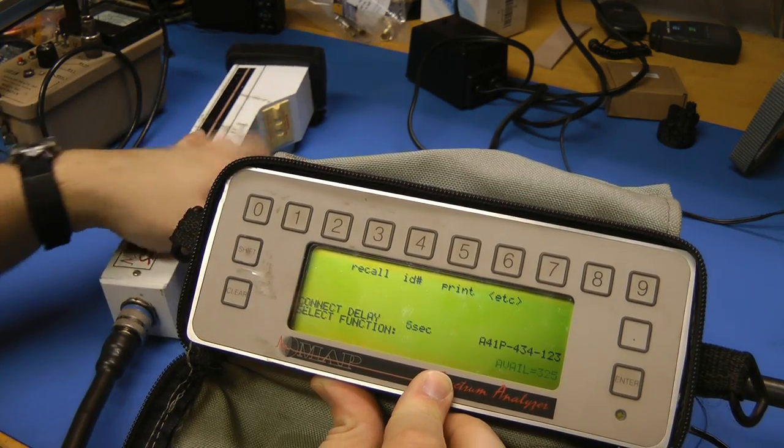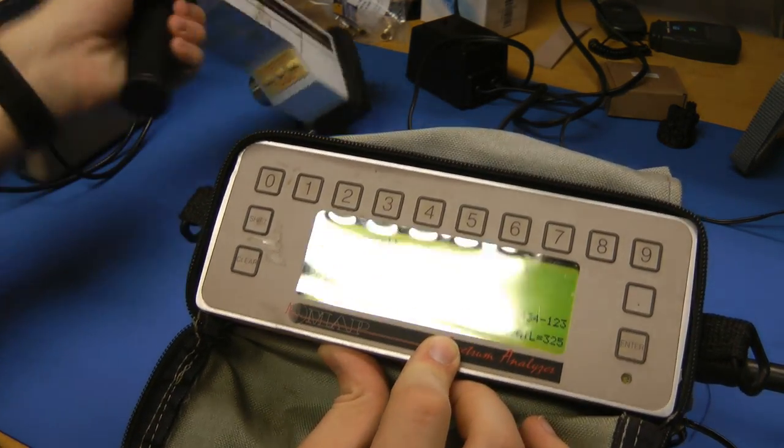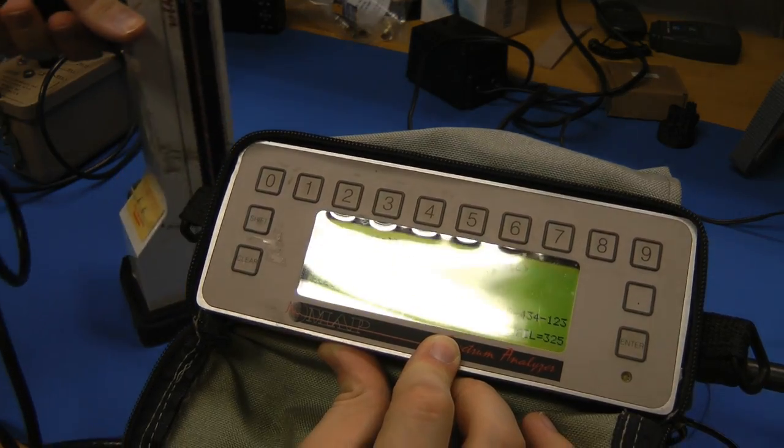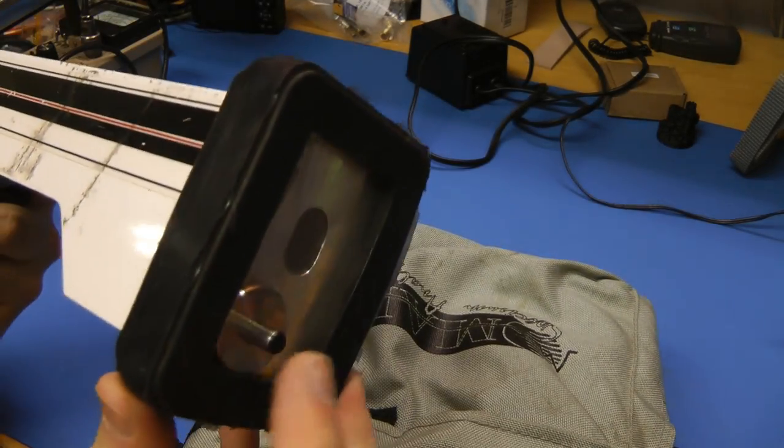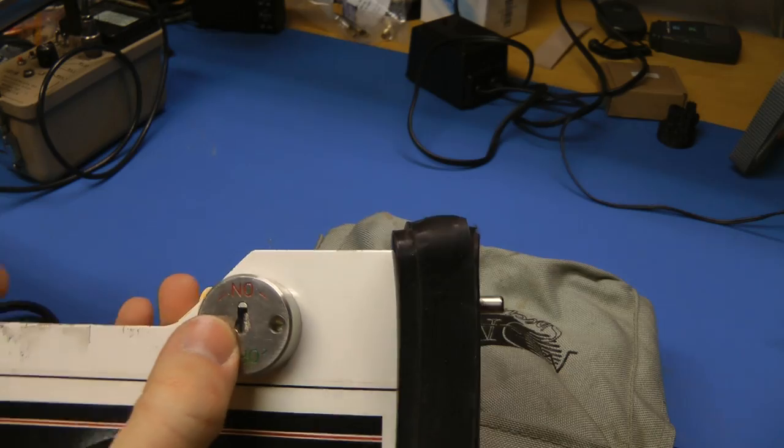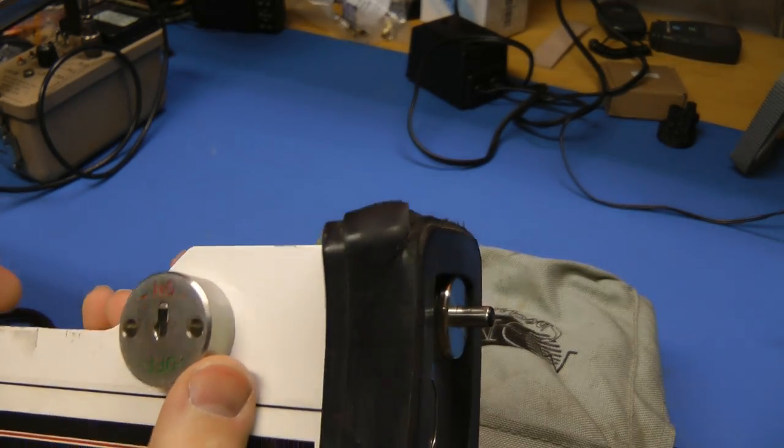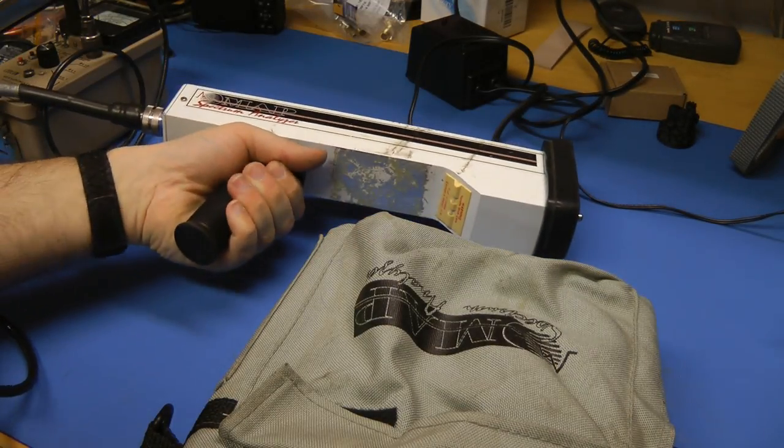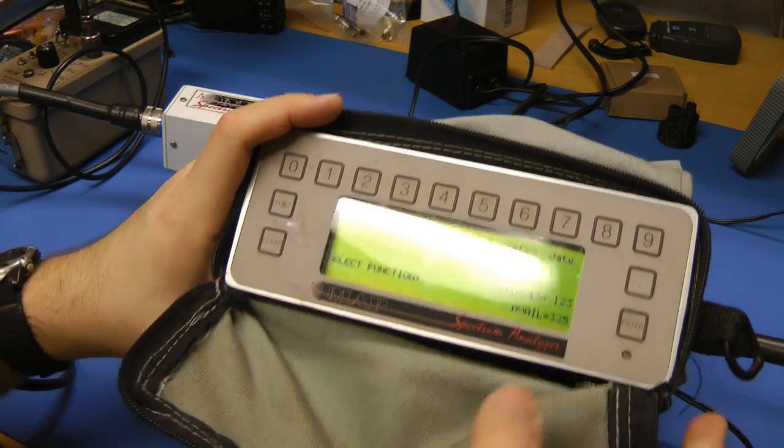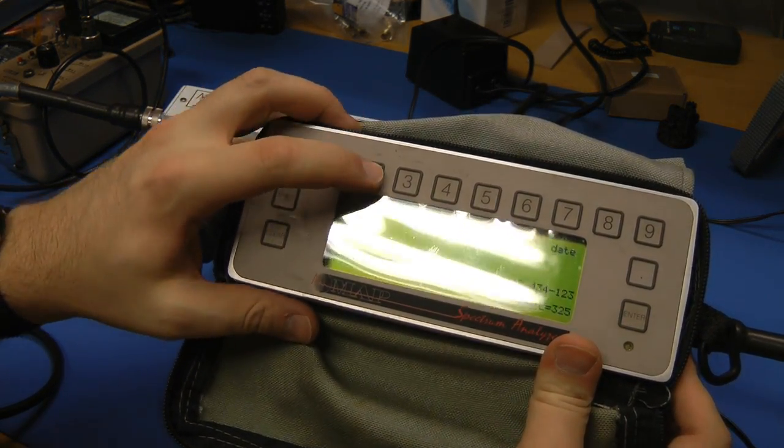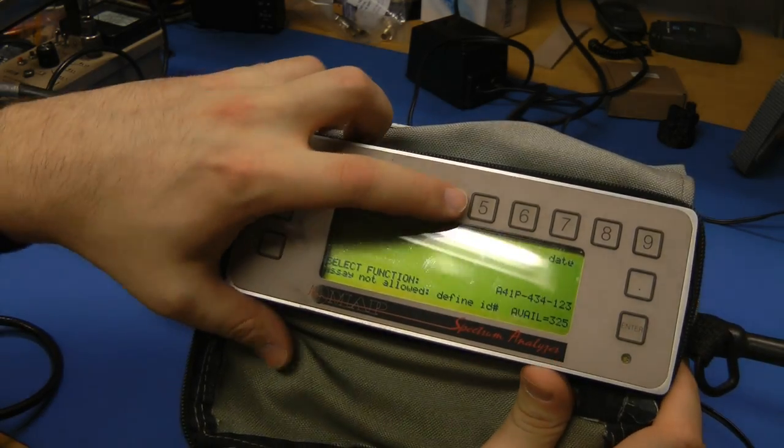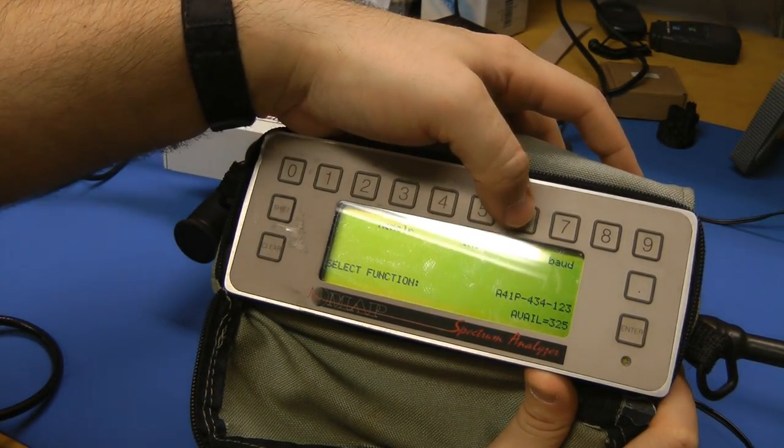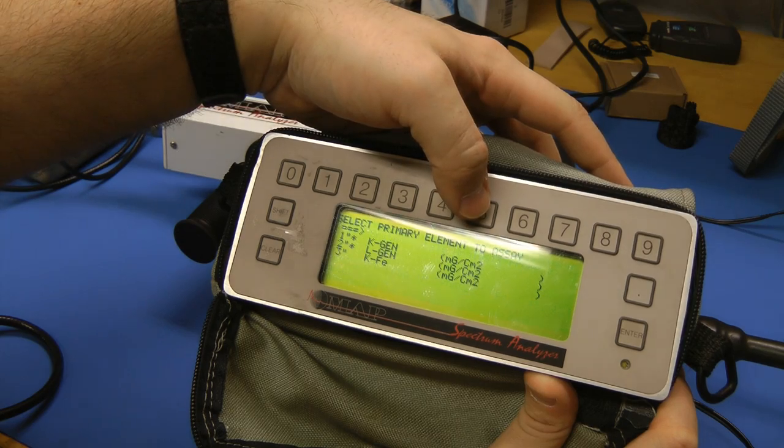How do we activate this? Do we just push it down? Nope. I suspect this thing here will open the source. There's another keyed enable thing here that's on the off position right now, so the source shouldn't be exposed. But I don't think there's much point trying to get this running. It's almost certainly not going to do anything.